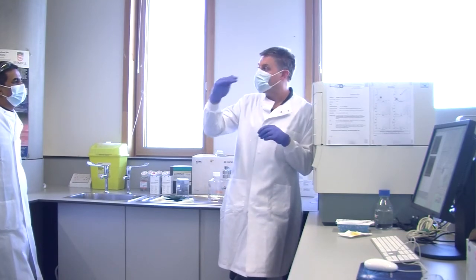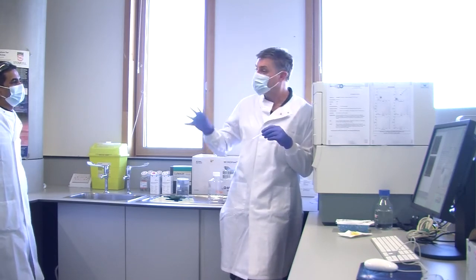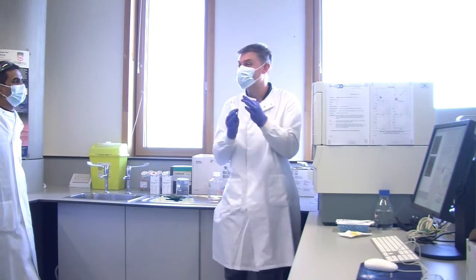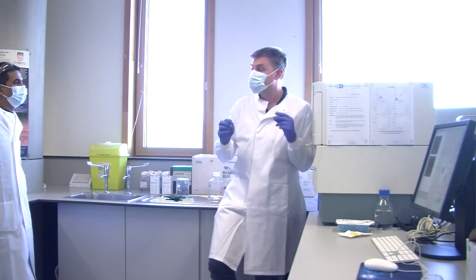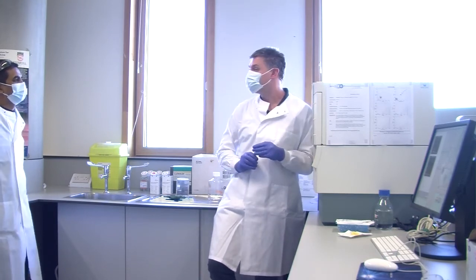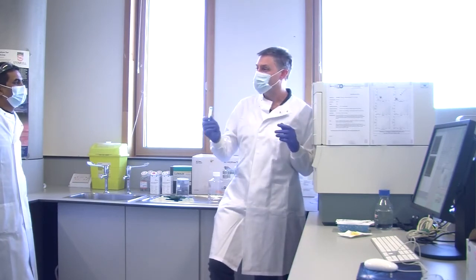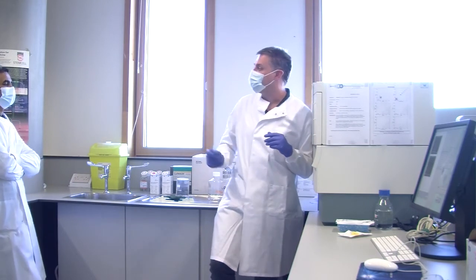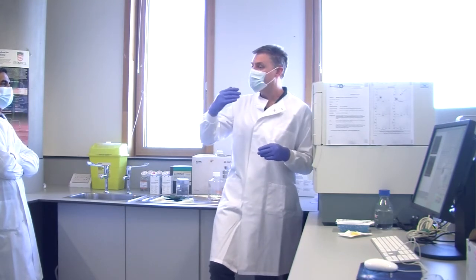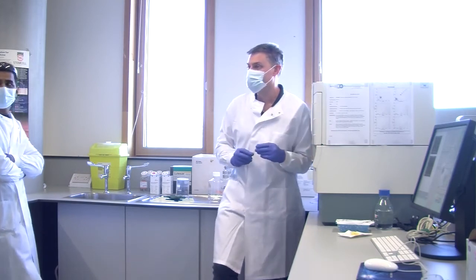You have to think about each of the stages you are doing, what you're doing, and why. In a way, when you're given a protocol like this, it's more difficult, because you are told by the experienced scientists running this practical, this is what you will do. Why are you doing each of the steps? You have to know that. And what I would say to you is, even in this sort of thing, feel free to ask why. Why do we do this? Why do we fix? Why do we permeabilize? Why do we incubate for 30 minutes? Why do we incubate on ice? Etc. Can you disperse the cells?